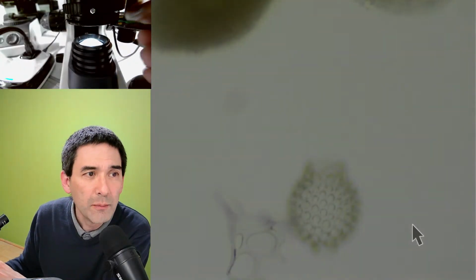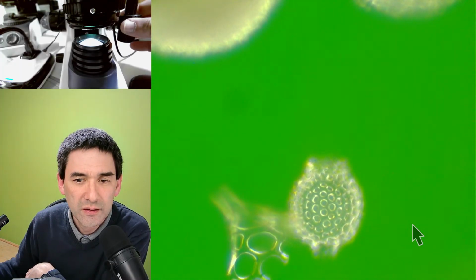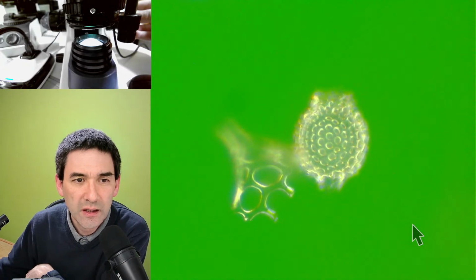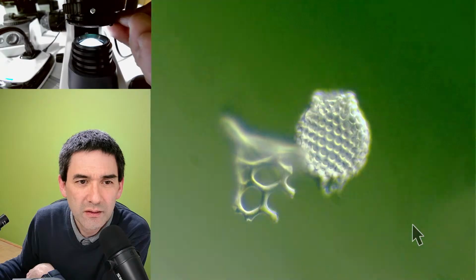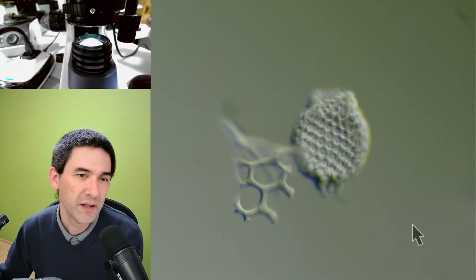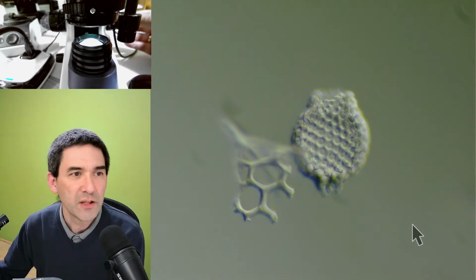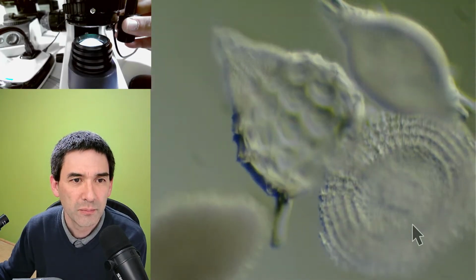So I'm going to exchange it again. Let's go down with the magnification again a little bit. So I'm putting in a green one, and this is how the green one looks. Again, if you start to move it out a little bit, the effect of the color isn't there anymore, for whatever reason. That's quite an interesting observation, and it's also something where we learned something. So that's essentially the radiolarians, and they're pretty nice.